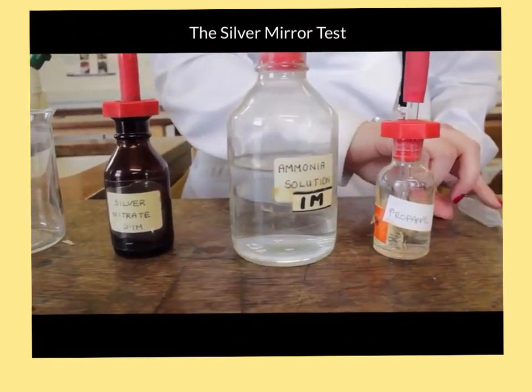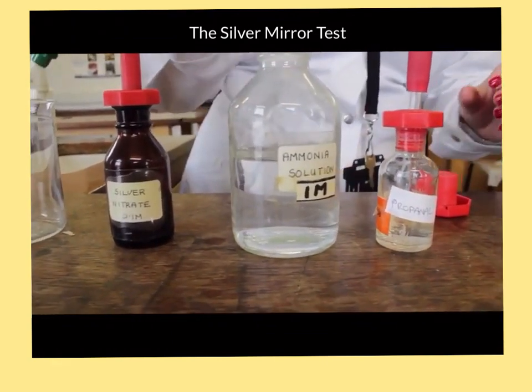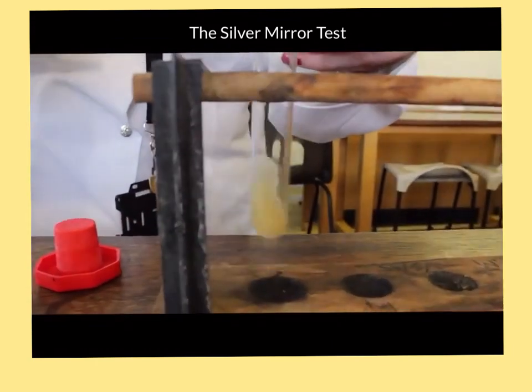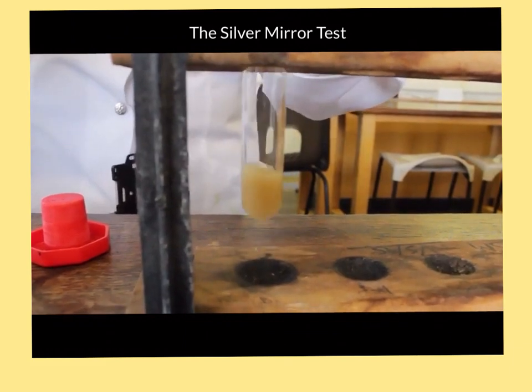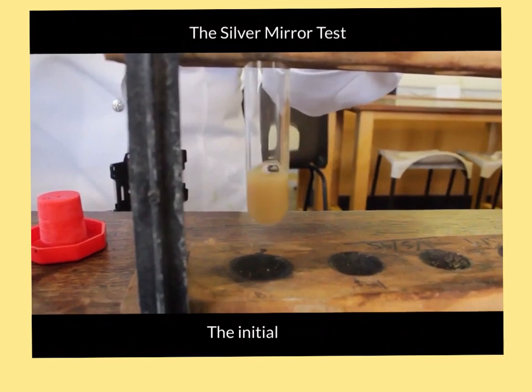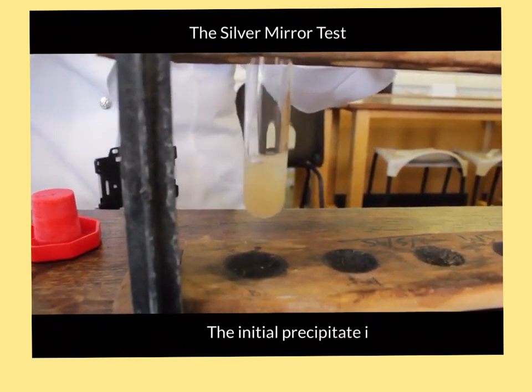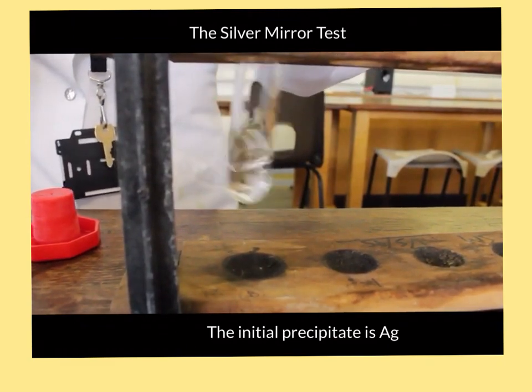It's important to add this drop by drop. As you add it drop by drop, give it a shake. You should see initially a precipitate of silver oxide forming. There we go, and then it disappears.